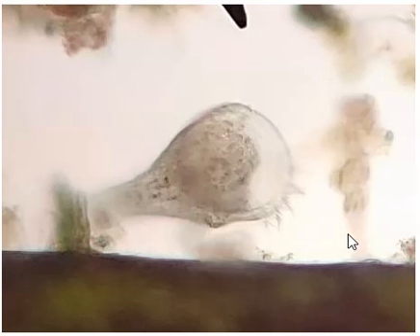In general biology lab the other day, we were doing an aquarium funk investigation. One of my students spotted what I believe is a stentor. I took a few snapshots through the ocular lens of the microscope with my phone and went home and cropped the image to enlarge it. I'm guessing this is several hundred to 1,000 times magnification, if not more.